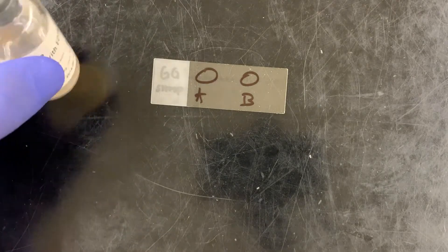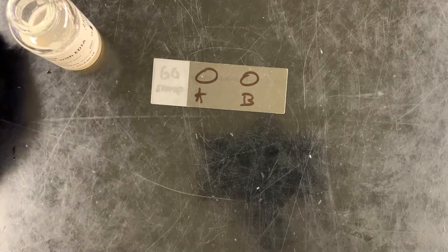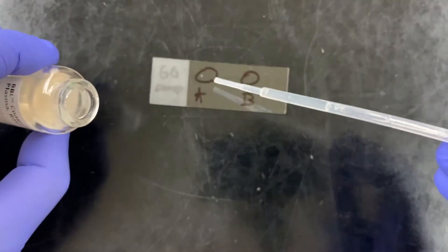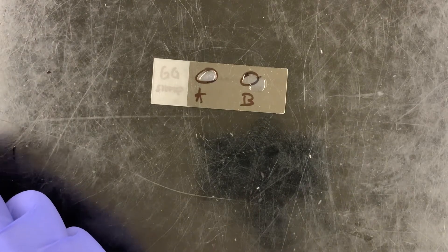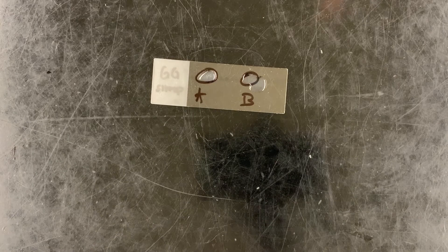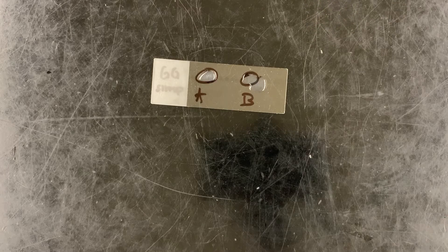The test itself is relatively simple and very quick. We simply take our rabbit plasma and add one drop — a decent-sized drop — into each test circle on a nicely clean slide. Then all I'm going to do is take my cells and drop them in.